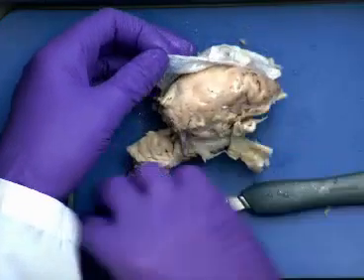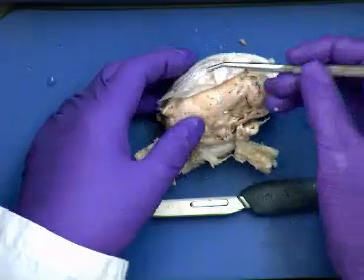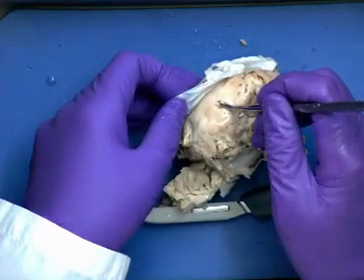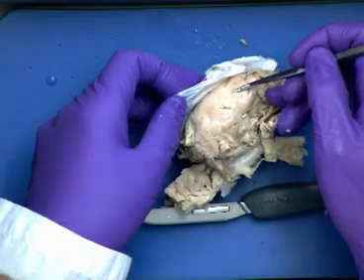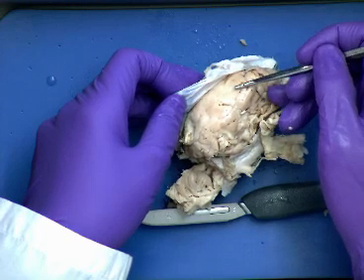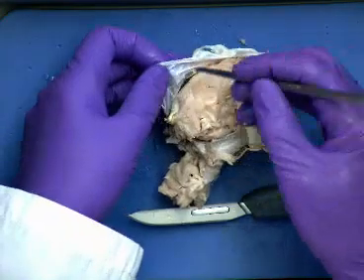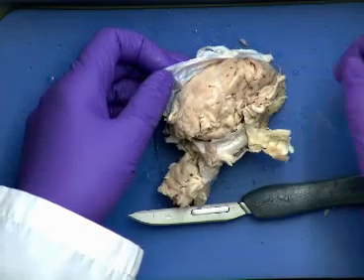So if I'm pointing to this, that is the dura mater. Now the pia mater, remember, is the innermost one. The pia mater is going to be like saran wrap right on the surface of the brain. We can see into some of the sulci here. If we get just inside here and kind of lift up, see how it's kind of catching there on a little membrane? That is going to be the pia mater. It's that delicate that we see right there. See, it's kind of lifting off like that. So that's the pia mater. The dura mater is the durable one out here, and the pia mater is the one just right on the surface of the brain itself.